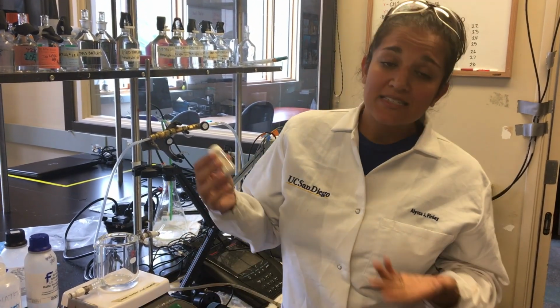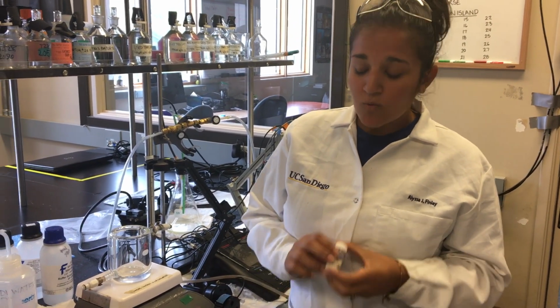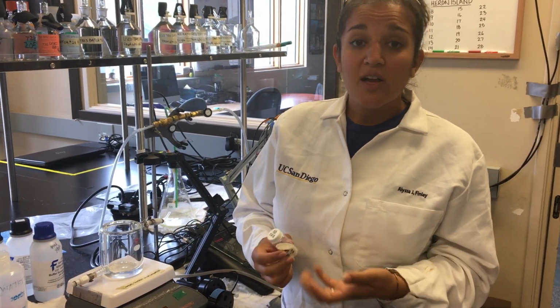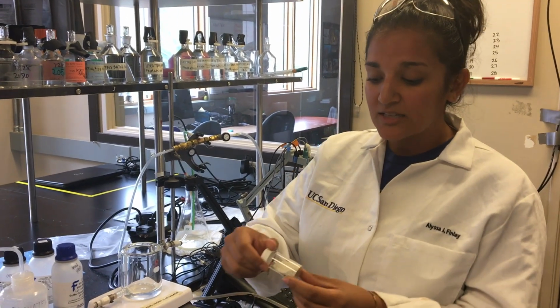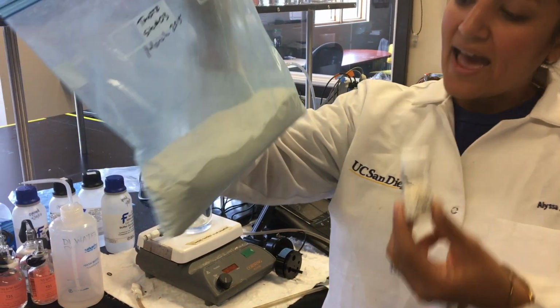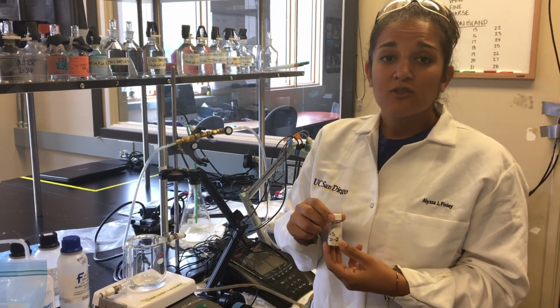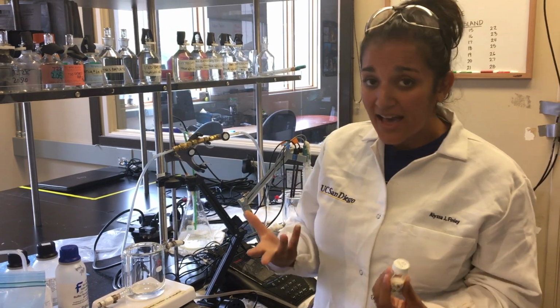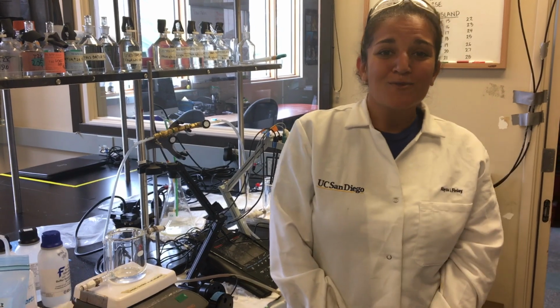So what we're finding is that different sands are actually going to respond differently, which is what we would expect. But what we're really trying to figure out is why. So why are these sands responding to these changes differently? Is it because of their grain size? So you can see this one is way chunkier than this really fine one, so is that controlling it? Or is it that some of them are made of different materials? So are they made of different types of calcium carbonate minerals, and is that controlling the dissolution? So that's my setup, and that's what we do.